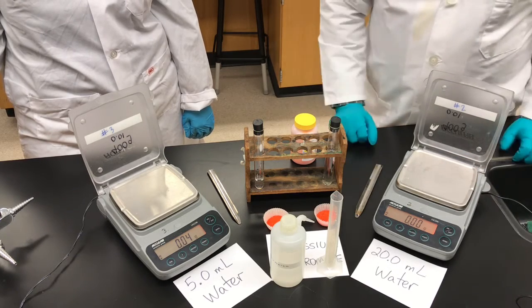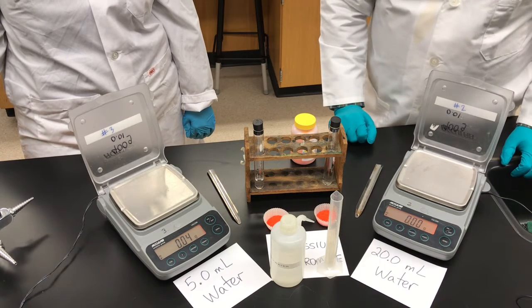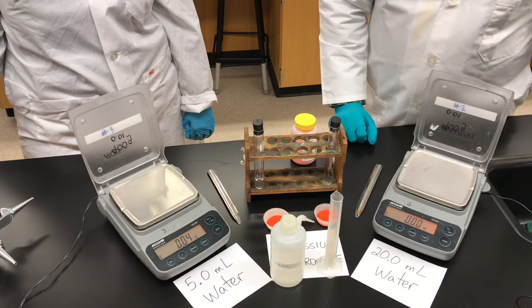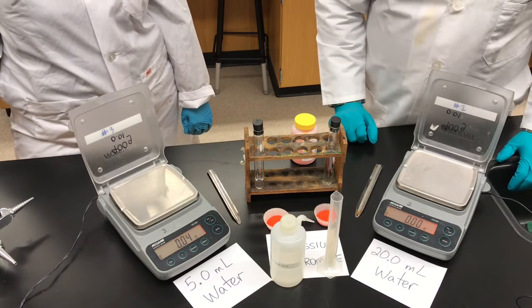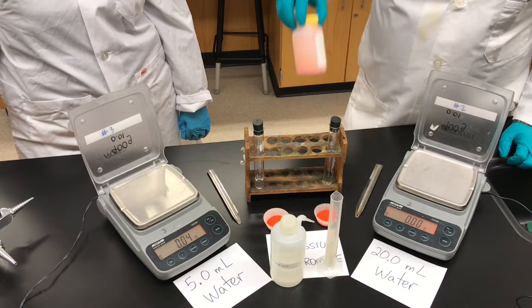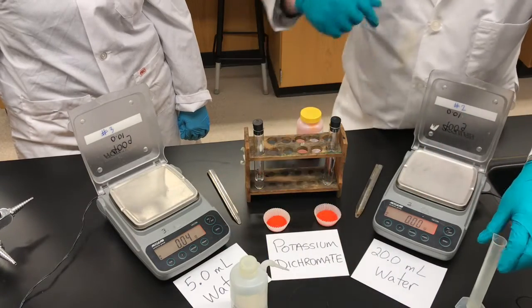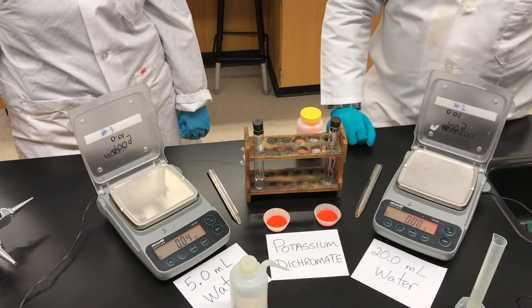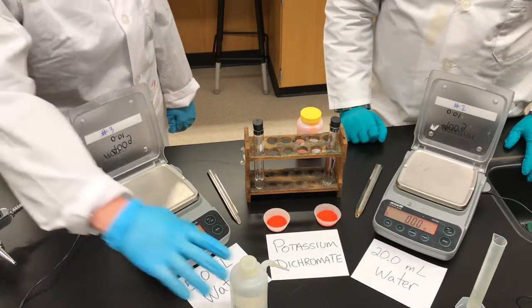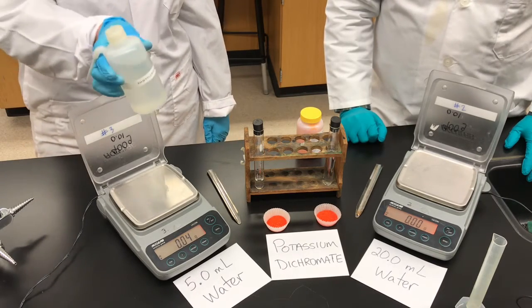If you're a grade 9 advanced student opening your booklet for this lab, there are some definitions you need to know. When you're making solutions you're always going to be dissolving a solute. The solute is the substance that is being dissolved. In our experiment the solute is the potassium dichromate — this orange colored salt in the dish. The solvent is what the solute is dissolved in. In this lab the solvent is water.